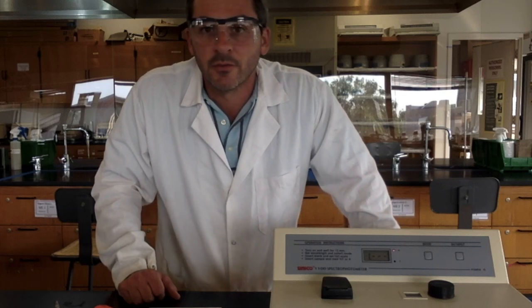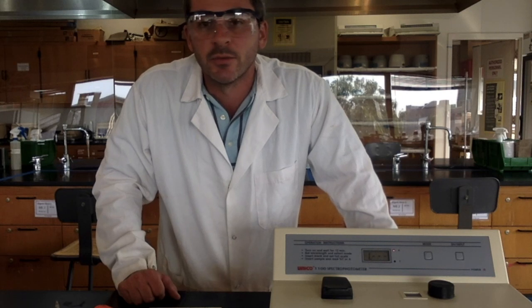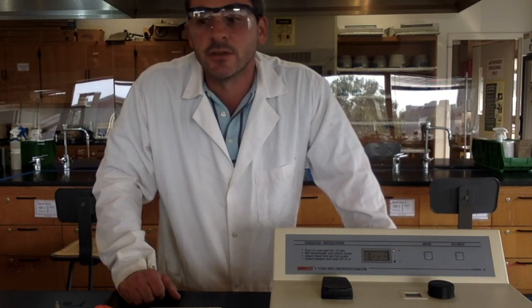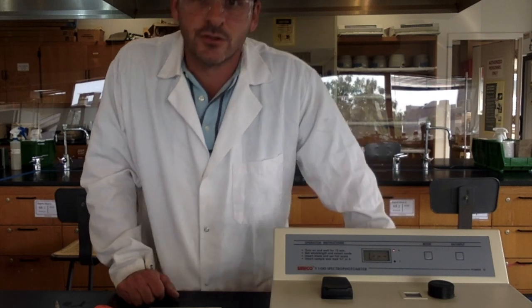Hello everyone, it's Professor Sabatini here at Passaic County Community College, and today we're going to be doing Experiment 3 for Chem 111, which is the spectrophotometric analysis of food dye solutions.